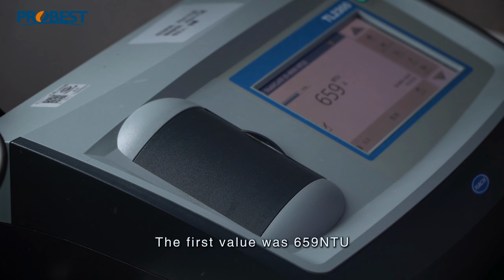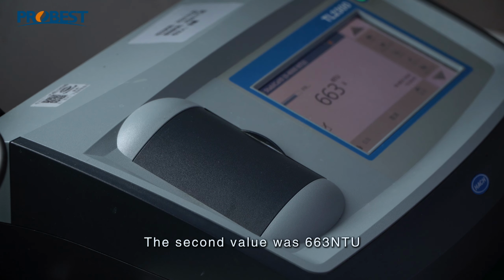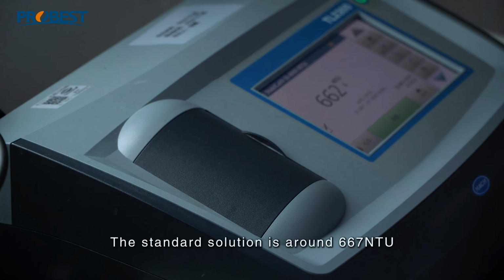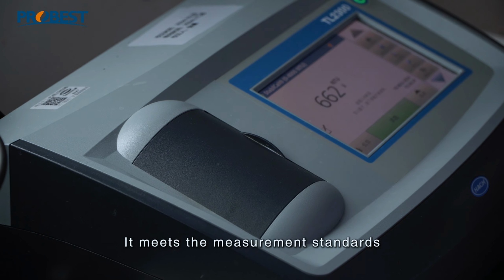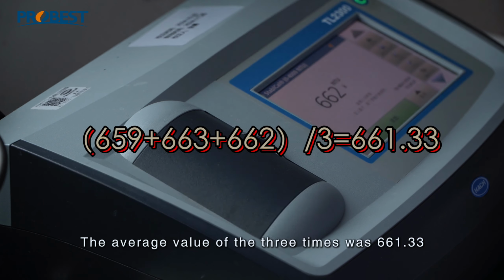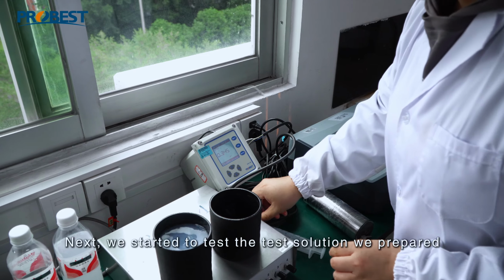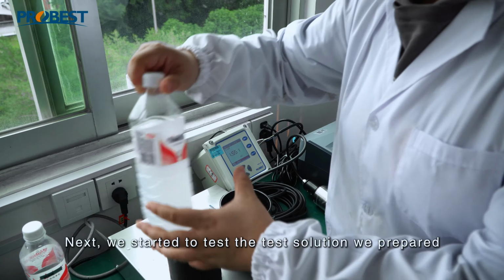The first value was 659 NTU. The second value was 663 NTU. The third value was 662 NTU. The standard solution is around 667 NTU. It meets the measurement standards. The average value of the 3 times was 661.33. Next, we started to test the test solution we prepared.